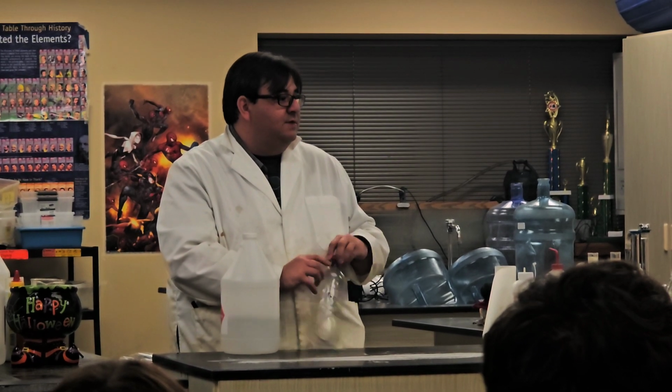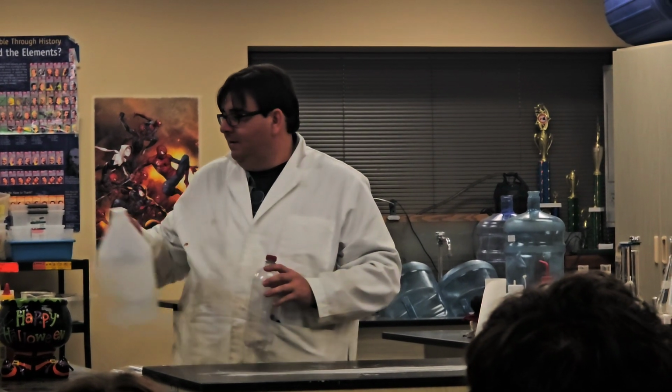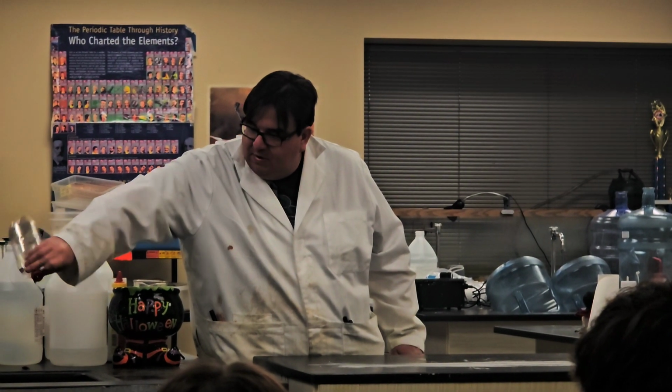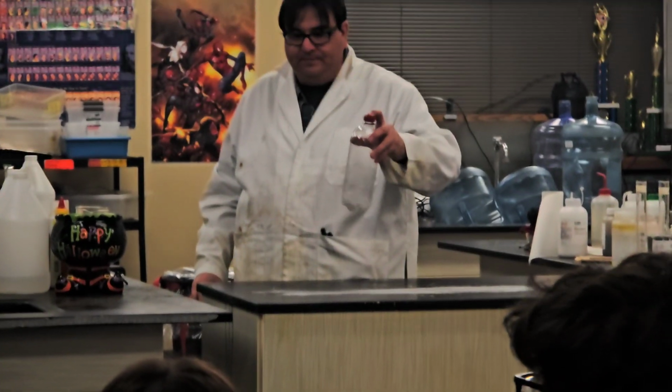You guys are just gonna get hit. Okay, so never try this at home. This one actually is super, super dangerous. And a teacher in Adams City actually got fired for this one. So don't ever try this at home.